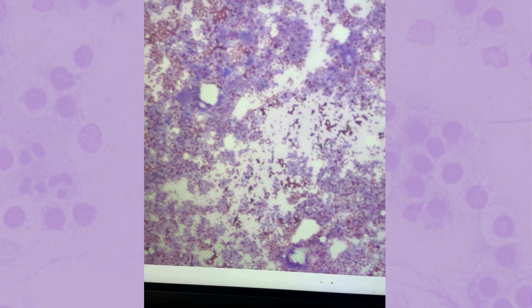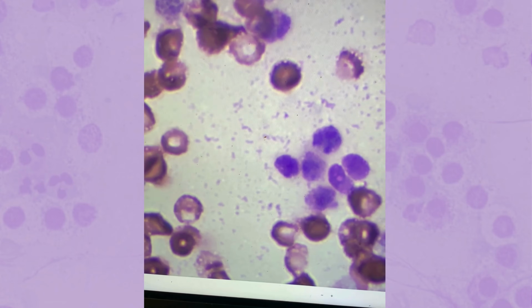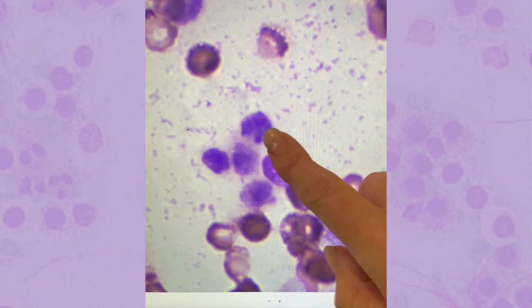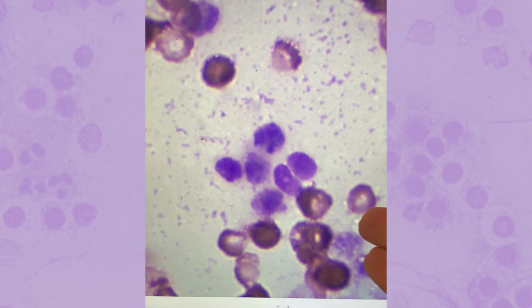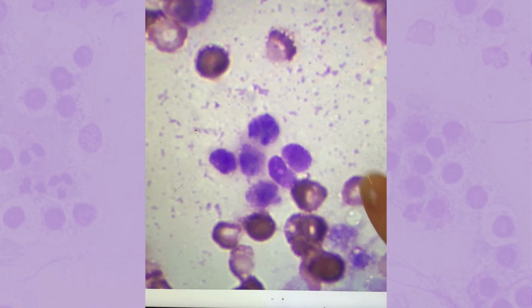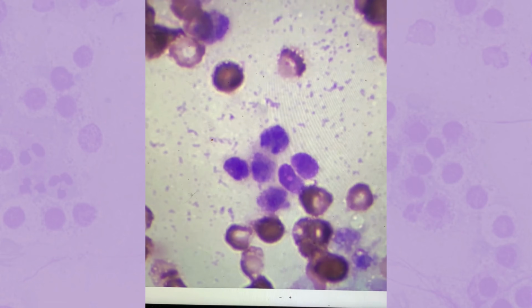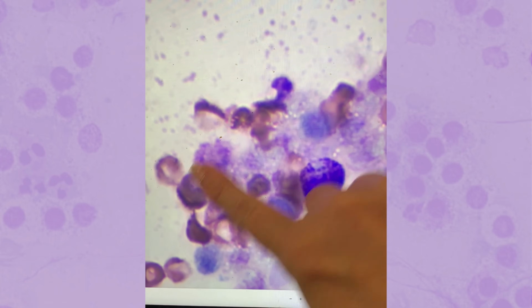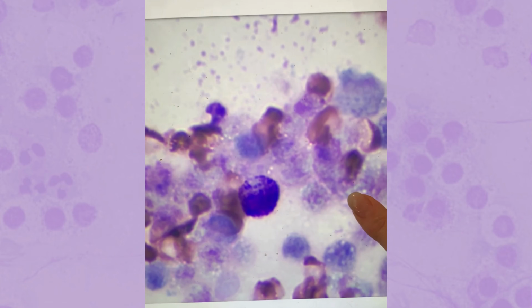But in this case, the cells just look necrotic. These are all red blood cells, but these nucleated cells, we got a good sample here in terms of it being cellular, but these cells are smudged. It's almost like if you stuck your finger on it and just smushed them. That's what necrosis looks like. And it also makes it so that the cells don't pick up stain very well.